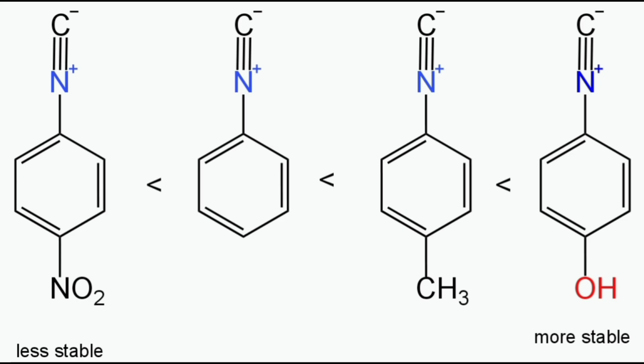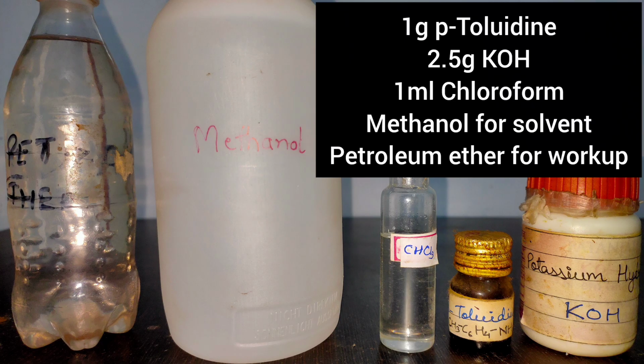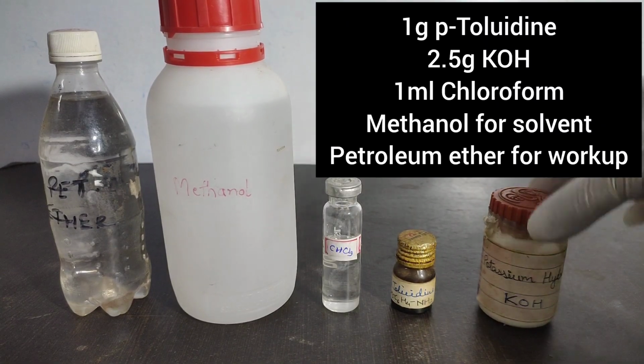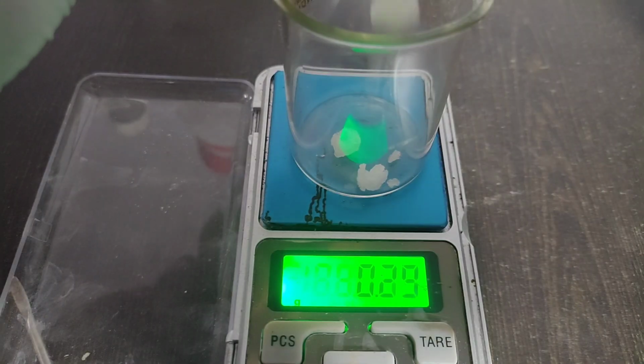Since I didn't have para-anisidine or para-aminophenol, I chose para-toluidine over aniline and para-nitroaniline. Also, phenyl isocyanide has a very strong offensive smell, that is why I chose not to make it. To start the synthesis, I took 1 gram of para-toluidine, 2.5 grams of potassium hydroxide, 1 ml chloroform, methanol for solvent, and petroleum ether for workup.